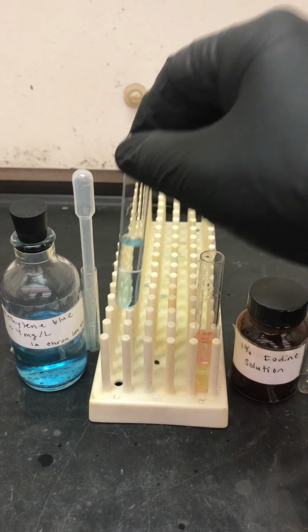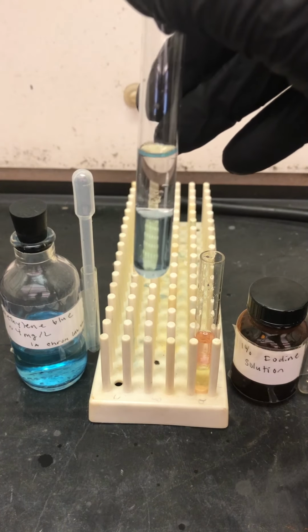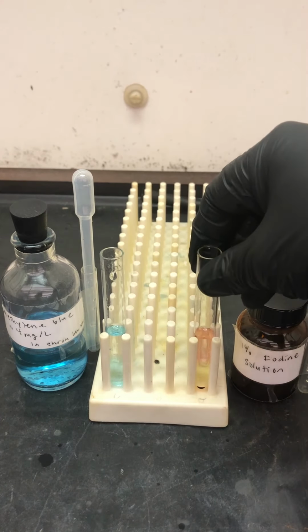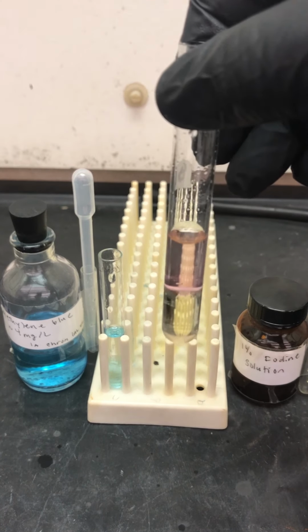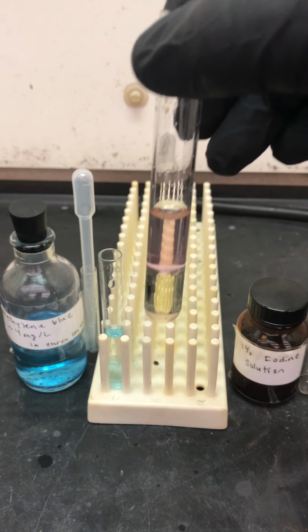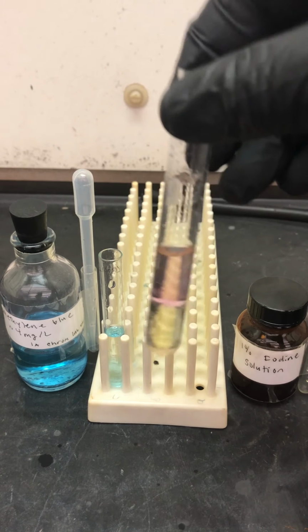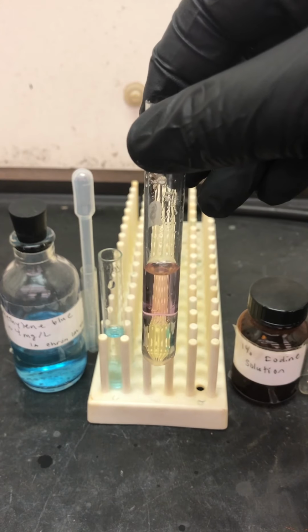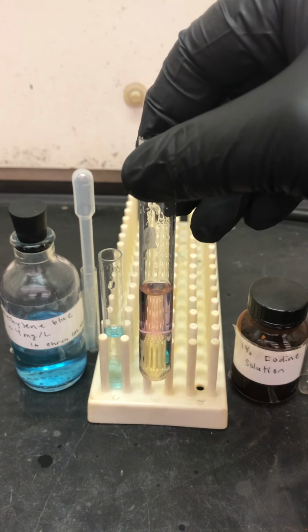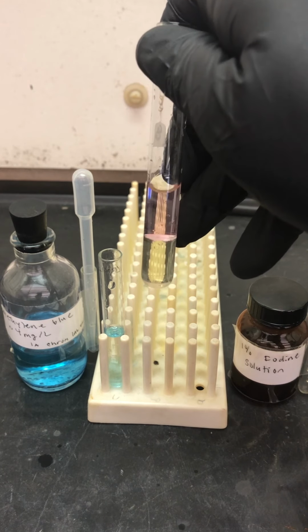Okay, we're coming back here, and again we can still see that the methylene blue remained blue in the bottom and colorless on the top. And you can see the kerosene is giving me a pink layer on top. There is still iodine dissolved in the bottom layer. We expect the bottom layer to be aqueous because water is denser than all of these nonpolar solvents. But what we would say is that most likely some of the iodine was actually soluble in the kerosene, and when it did so, it generated a different color in kerosene than it has in water.